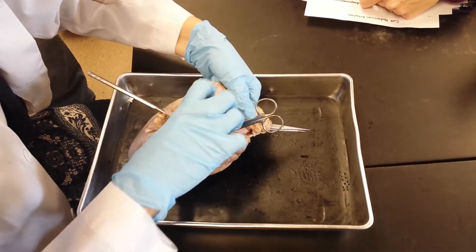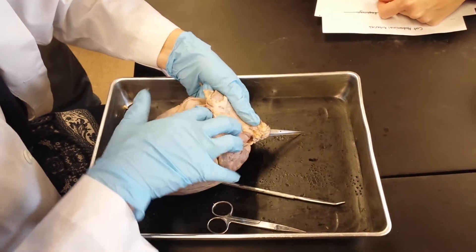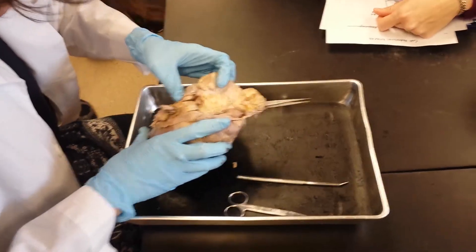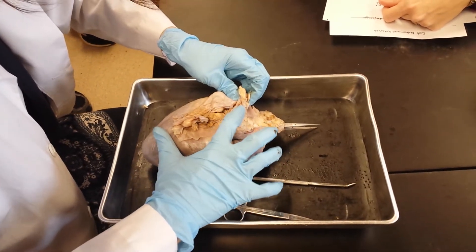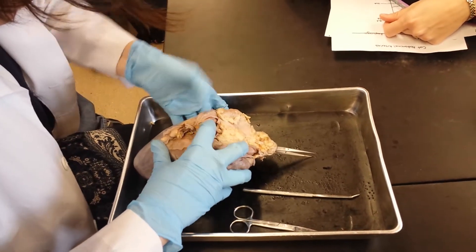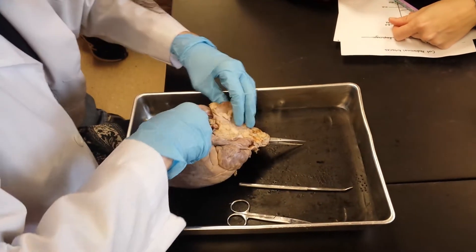Over here is where you'll find your pulmonary arteries and your pulmonary veins. Pulmonary arteries in general are much thicker walled — you can see that's got a really thick muscular wall to it. When I put my finger in it, I'm right in the pulmonary trunk, so this is one of the openings to the pulmonary artery. I've got to ask you at least a pulmonary artery and a pulmonary vein on here. I'll try to ask something where you can see the wall is really thick for the artery. The pulmonary vein is usually inferior to it and it's collapsed — it's got a much thinner wall, not nearly as much muscle, and it's completely collapsed. That's the vein; this is the artery.